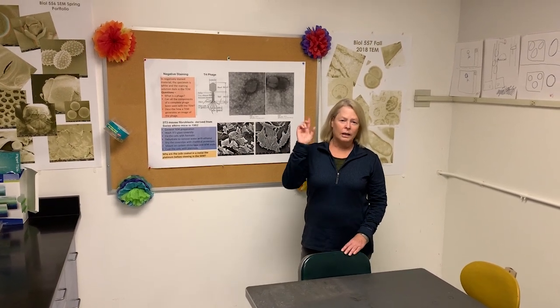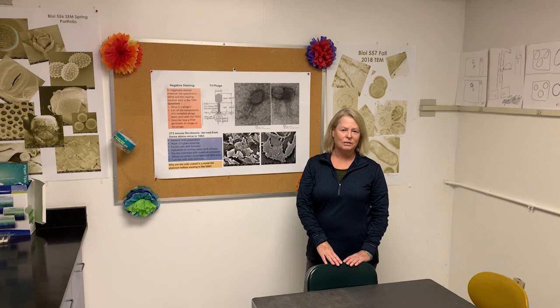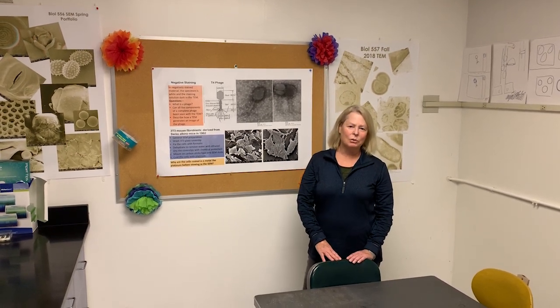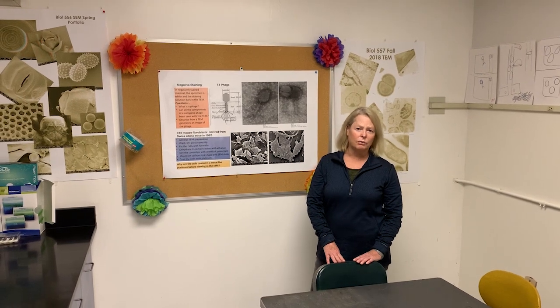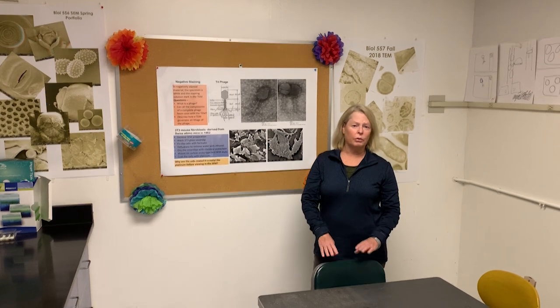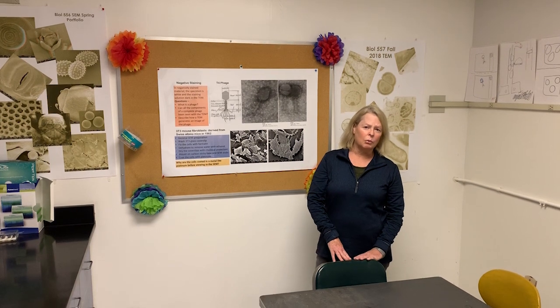I'm the director here at the EM facility, which is located at the catty corner of the EIS building, engineering, and North Life Sciences. It's hard to find, but at some point in time you should try and come down and find us. I've been here about 2.5, almost 3 years. We've been doing this same lecture and week for the last couple of years, but unfortunately we've had some issues this year. But what we're going to do is show you both the SEM and the TEM and show you the images and show you how it works.